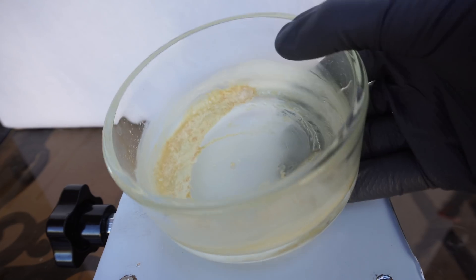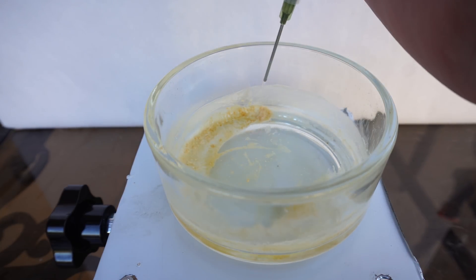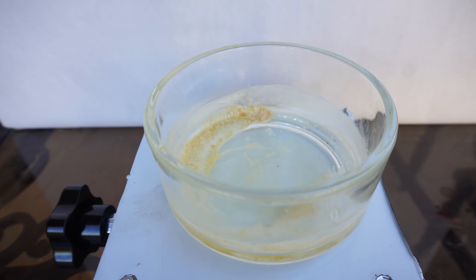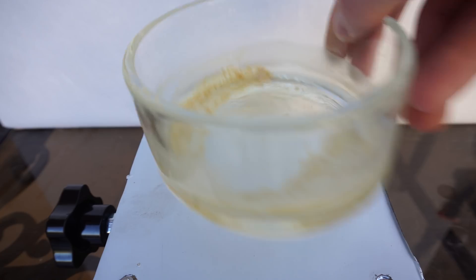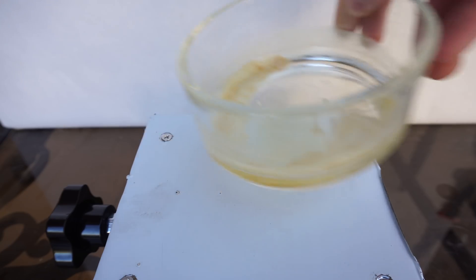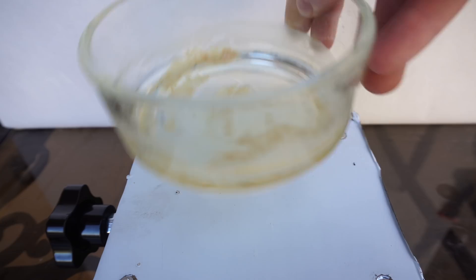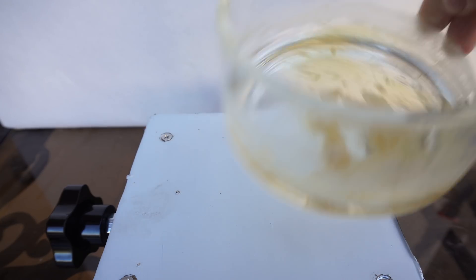Now for recrystallization. We used anhydrous ethanol that I made in a previous video. We want to make sure that the dish is still warm or hot while adding the ethanol. This will warm up the ethanol and increase the caffeine solubility in it. The real issue I had here is not having enough ethanol to fully dissolve everything. So I ended up having to reheat the dish a few times in order for everything to dissolve.